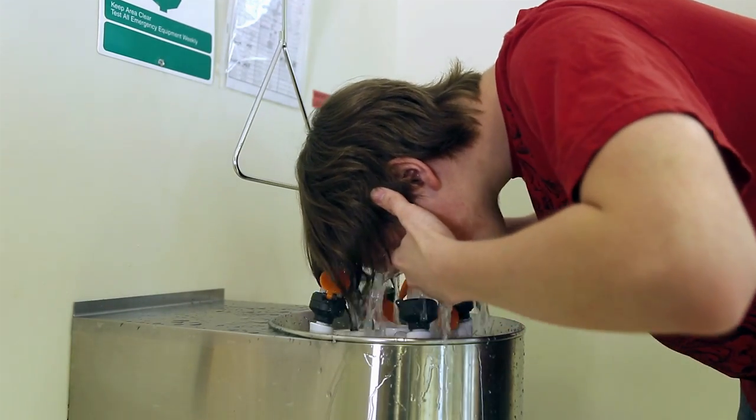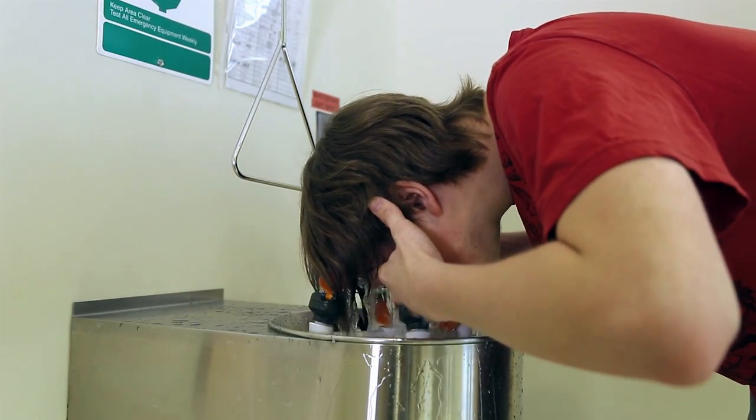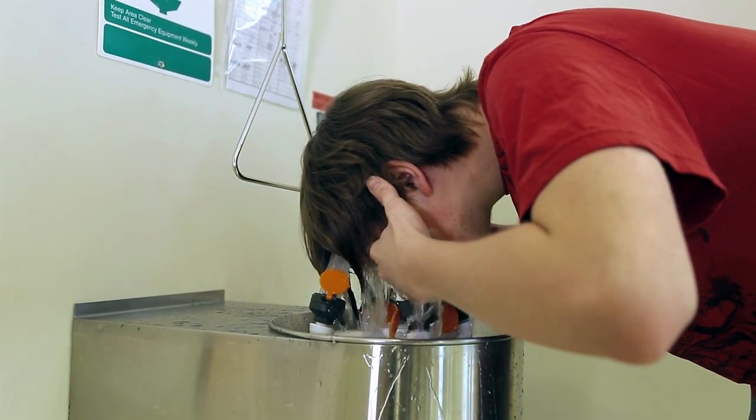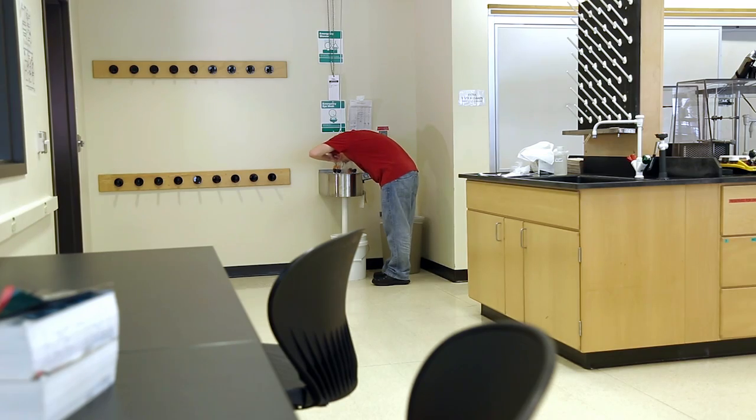Now you can use your hands to hold open your eyes during the washing process. If you wear contact lenses, you may remove them now.